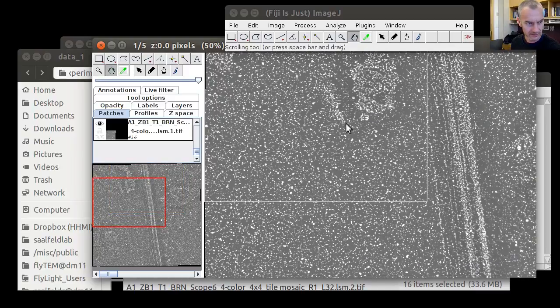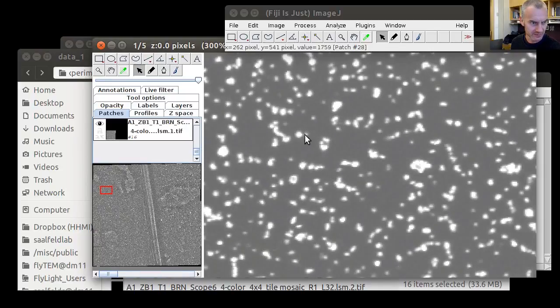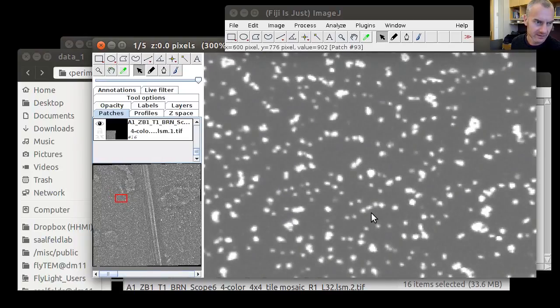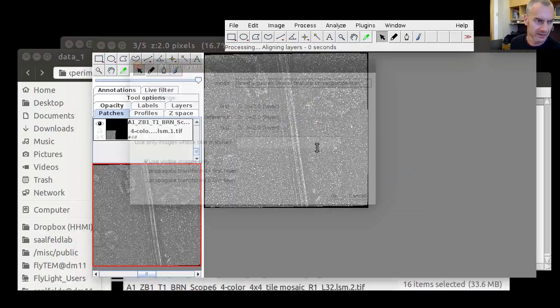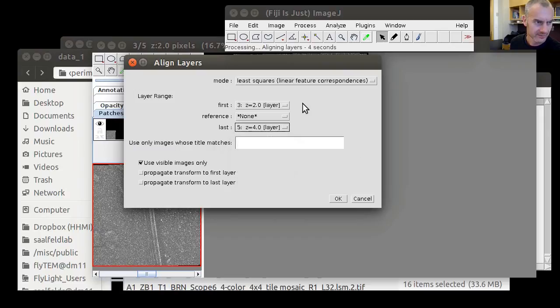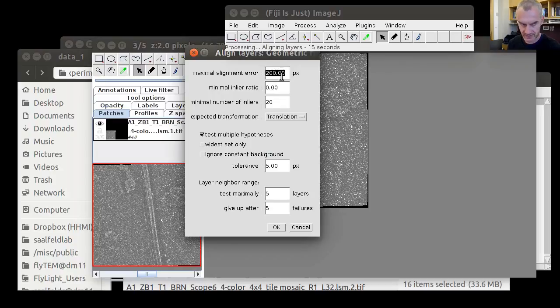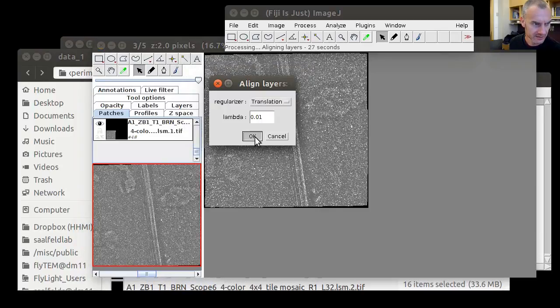So now we can also scroll through the layers. Fluorescent proteins are not always in the exact same location, but they cluster and accumulate around these beads. And given that, my impression is that the channels are reasonably aligned now. We can actually try to improve upon this by doing this align layers operation again. It goes from first to last, and we can try to see if that excludes any of the features that we got earlier. Everything else remains the same.